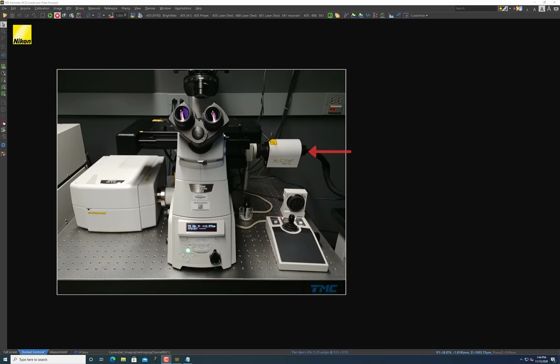So first off, let's begin by talking about the LED light source. You can actually find the LED light source on the right side of the microscope. I'll put a picture of what that looks like. And if it wasn't clear, the LED light source uses light emitting diodes for illumination, and filter cubes are required to filter the light from the LED light source so that you can match that to the fluorophore you're trying to see. So if you're trying to see GFP, you would want to turn on the light source, of course, but then you'd also want to put in place a filter cube that's specific for GFP.